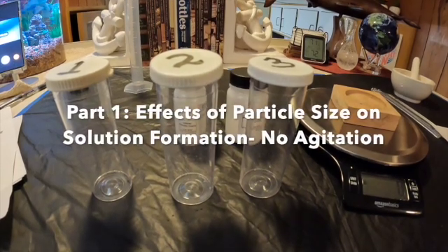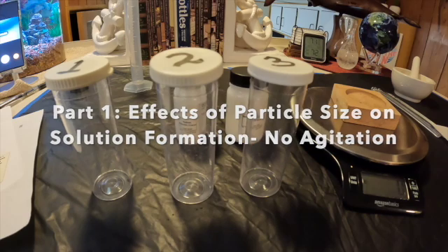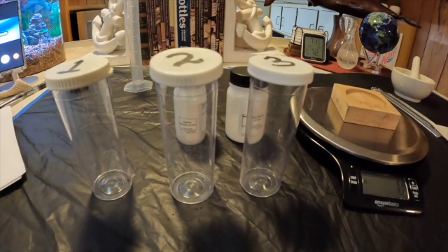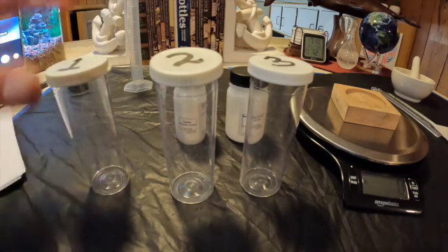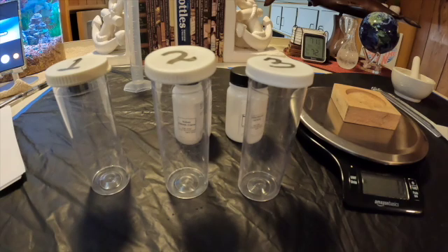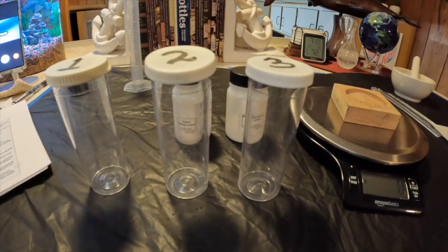For experiment number one, we're going to be looking at the effects of particle size on solution formation. I have everything set up. I have labeled the vials one, two, and three, and we're going to start out by measuring our amounts and different types of salt to go in each vial.